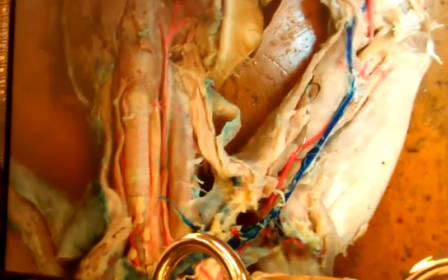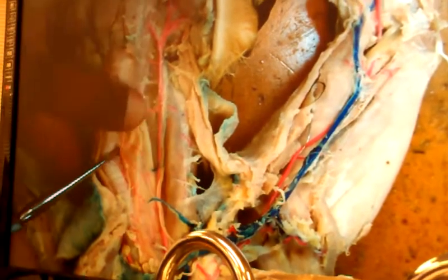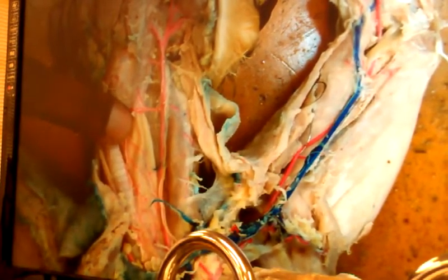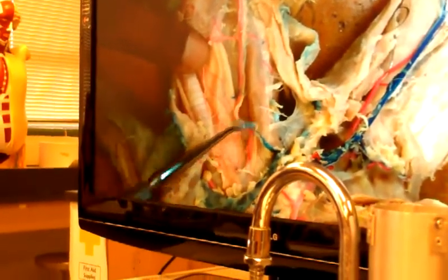Okay, Mr. Gilmore, I got that much. Now I want you to walk me through this throat. If you walk me through this throat, Mr. Gilmore, I think I can really get this. Alright? And we're going to do it just like this. You'll notice, Mr. Gilmore, here is what we call the left subclavian, and he came all the way up. Now, I really need to remove this nerve off of this hole, so you can see it clear as day.